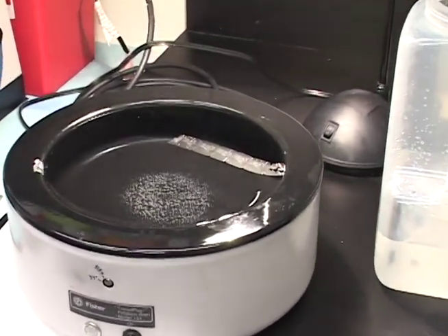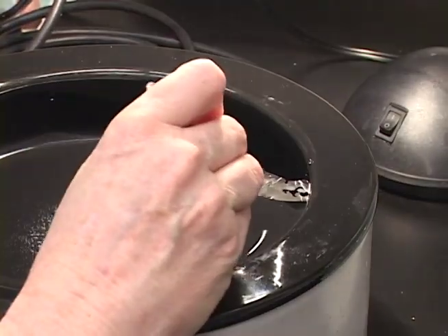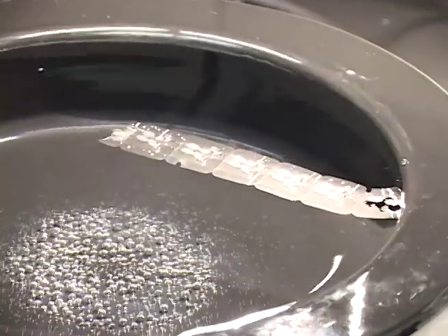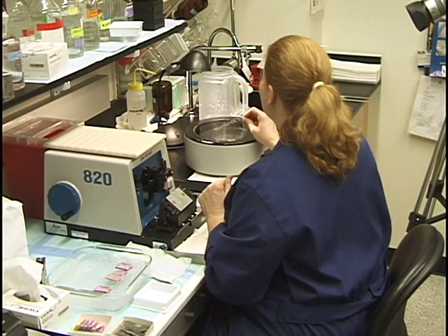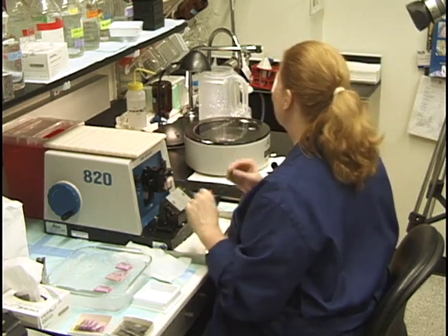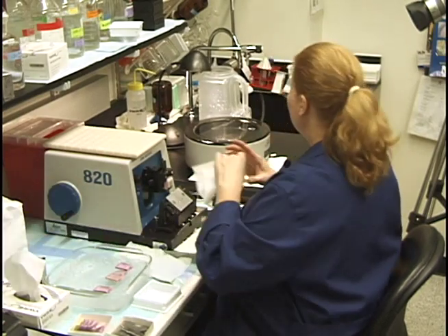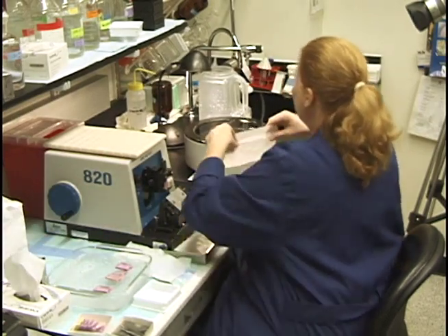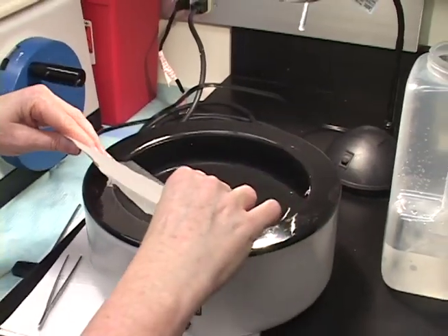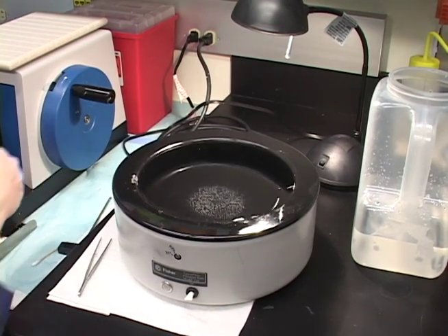When I re-faced this block it needed just a little bit more. There's only one section out of this bunch that is any good — it's acceptable, I could take it if I was only looking for one section. Really I would soak the block more and move on to another block. Between each block you want to swipe your water bath with a Kimwipe, so you don't pick up any extraneous tissue from the previous ribbon.